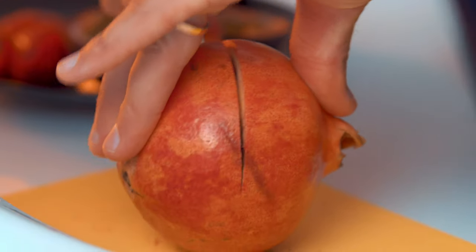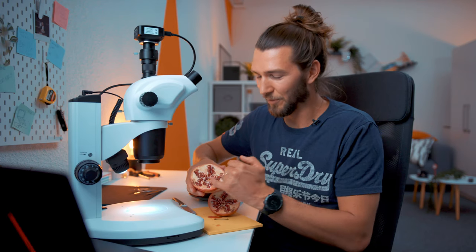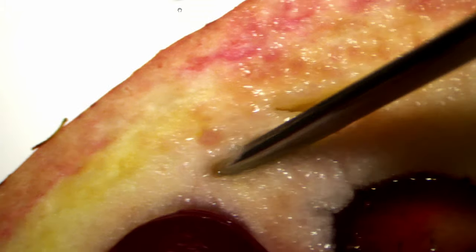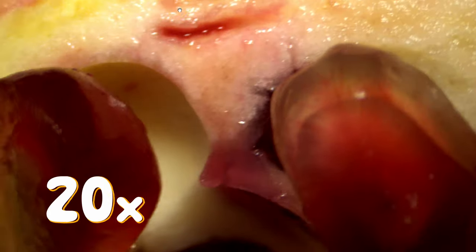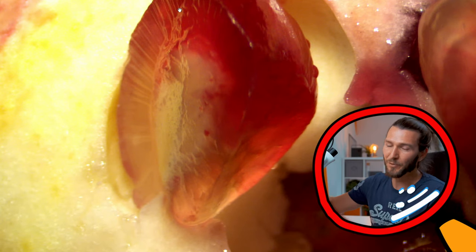It's cool how these simple microscopic things make us so happy when we eat them and enjoy them as an afternoon snack. Last but not least — the pomegranate! You can see the outer protection layer and then all the seeds inside. We only eat the seeds. At 20x magnification, there's the outer layer — very thin — and then the white part, which is quite tough in texture and super hard to get through to your delicious fruit. Let's look at this seed — pulling it out now. It's so beautiful! The light shines in from the back and creates a cool effect — you can see all the veins. Putting it on the stage in the backlight you see more contrast — veins are all over the place in the fruit. Wow.